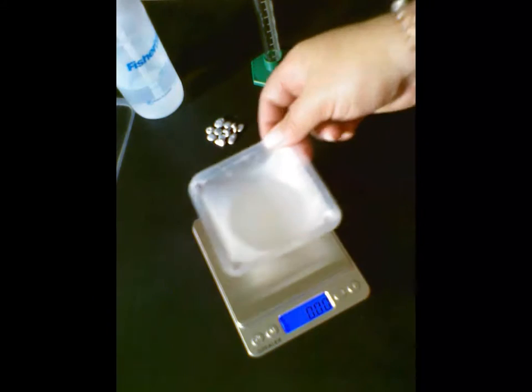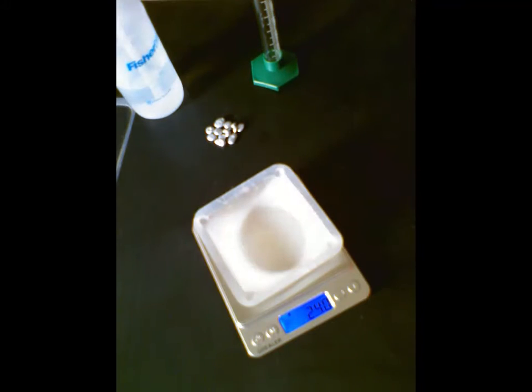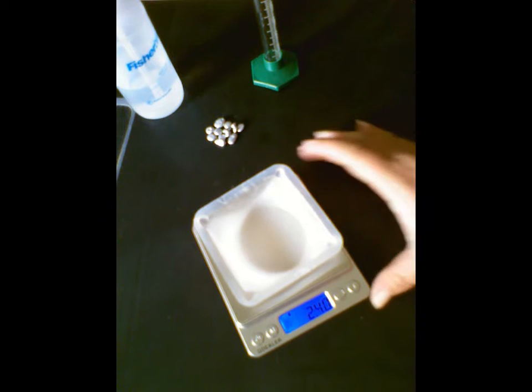If I take this weigh boat, my first step is going to be to put that weigh boat right on my balance, and I'm going to use this tare button here. Hopefully you've done this already. Usually you do it in middle school. Depending on what class you were in last year, you might have done it. You might have missed out if we were virtual, so I just want to make sure we all have it.